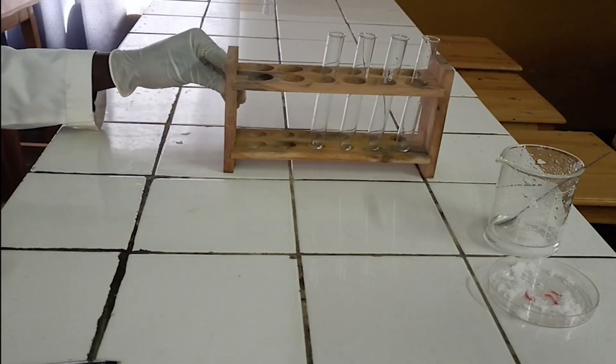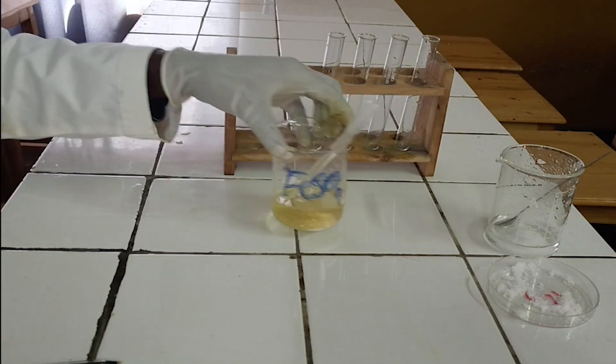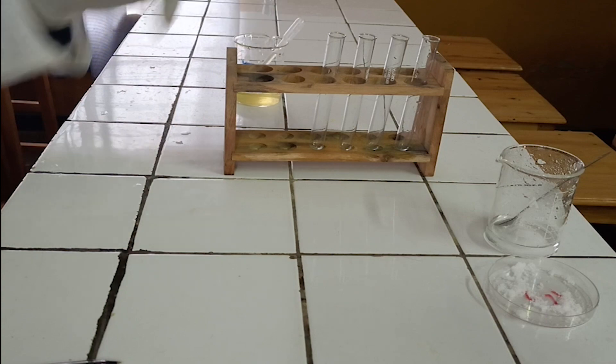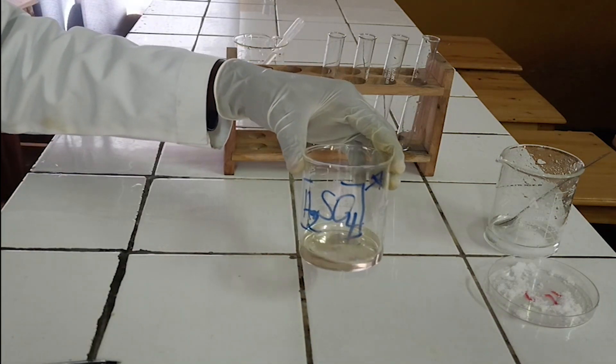Chemicals required. 1. Iron-2-sulfate solution freshly prepared. 2. Concentrated sulfuric acid.